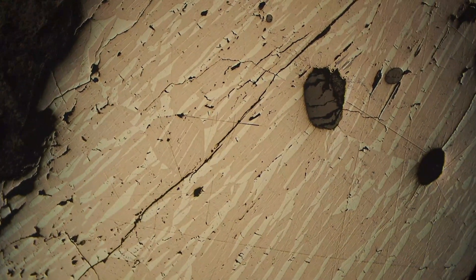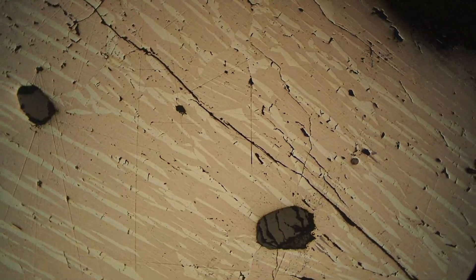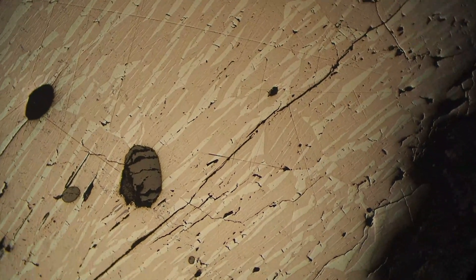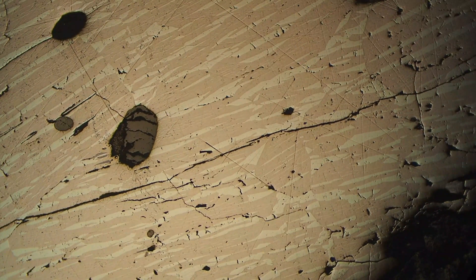Again, it can sometimes be more extreme, going from pink to a dark brown, but this particular sample has a more subtle bireflectance. Ilmenite is also quite hard, so if we had multiple minerals we could see some variation in hardness.